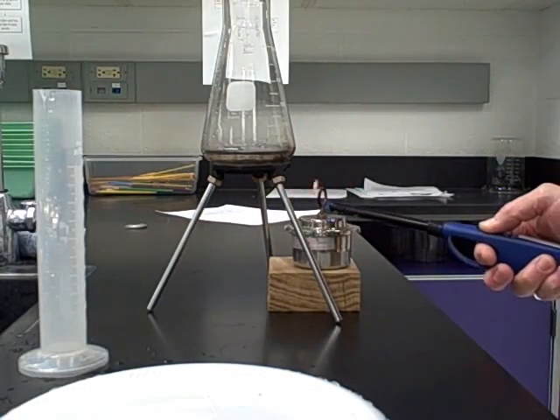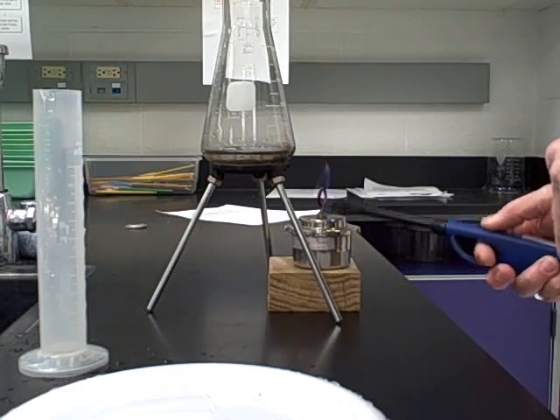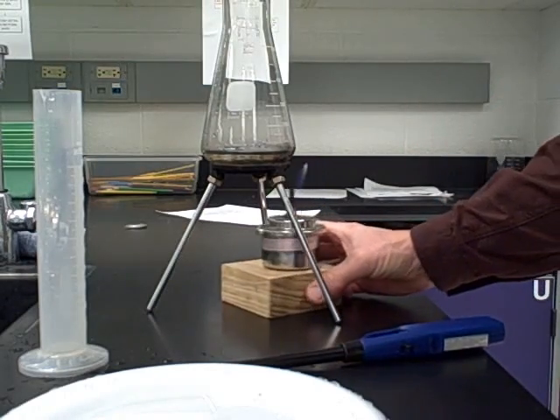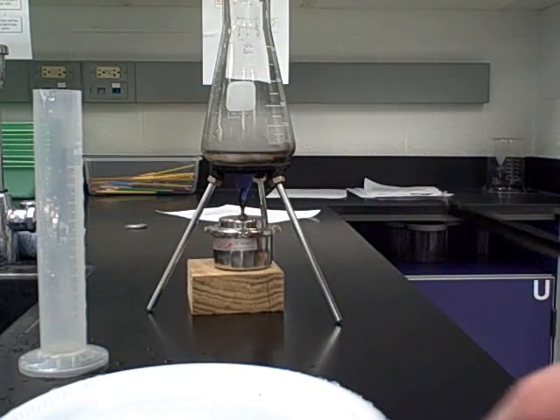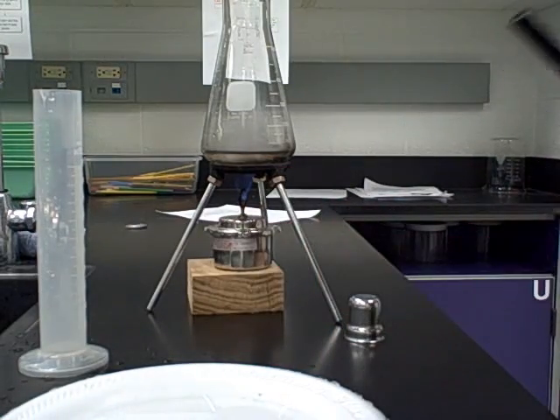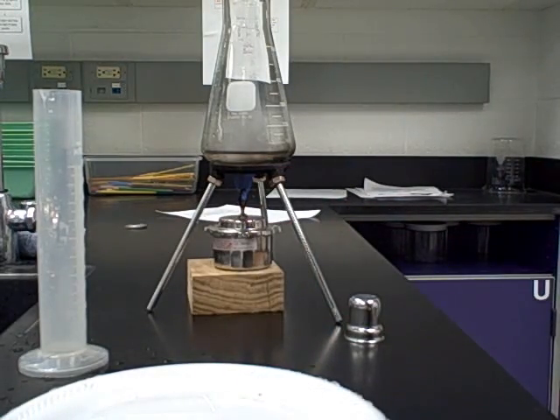You'll then place the flask on the ring stand, light your fire, and slide that under there so the water begins to heat. We want to bring it to a boil, and then you return to your seat and we will be discussing Charles law for a while until we move on to phase two.